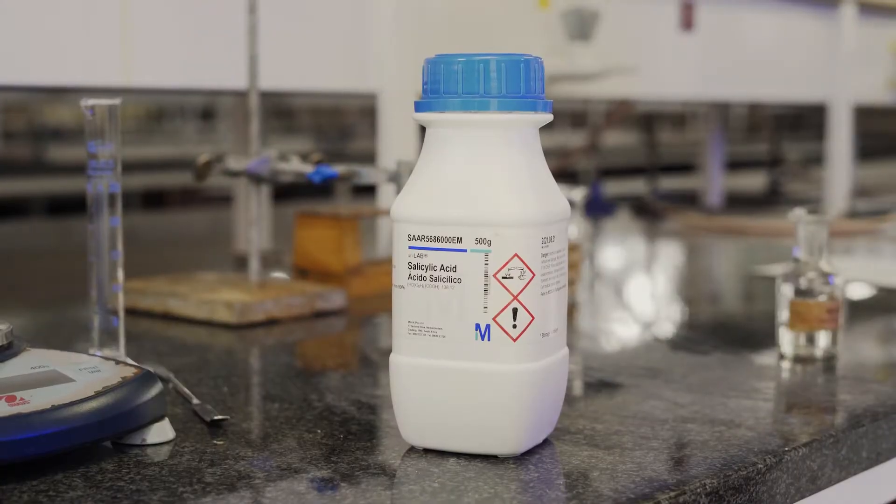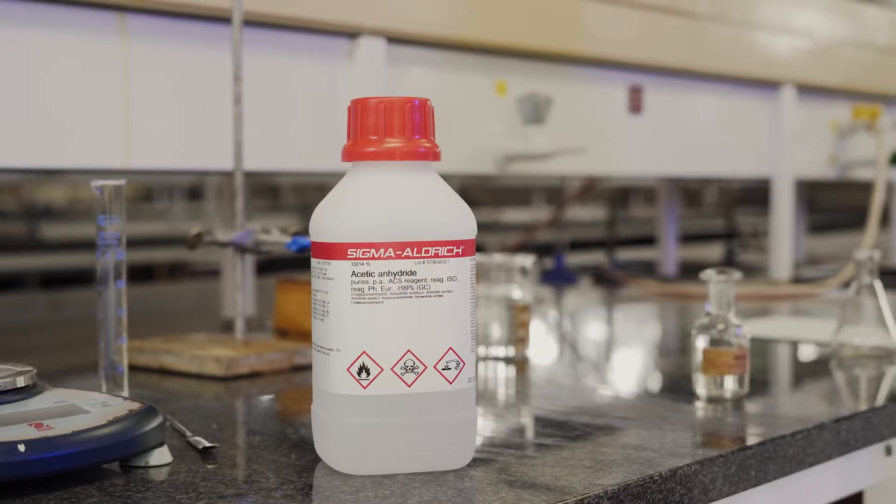Good day students, I'm Lorelie Kenz and today we're going to synthesize aspirin. We're going to do this by adding salicylic acid to acetic anhydride. We're going to follow a few steps using ice and water and then we're going to filter out our crystals using a Buchner funnel. Thereafter you have your purified aspirin crystals, and as easy as that we have homemade aspirin.